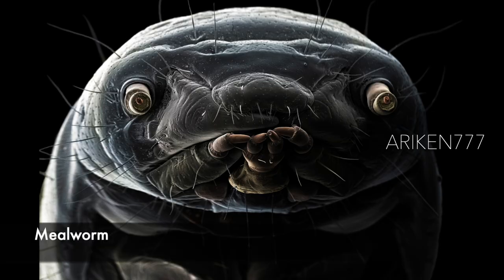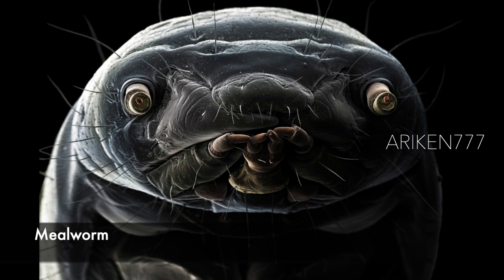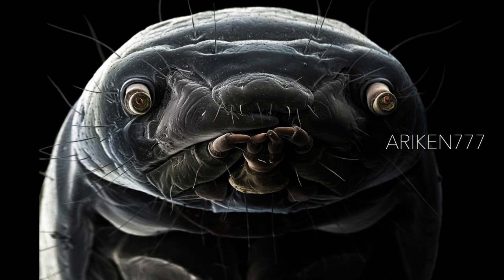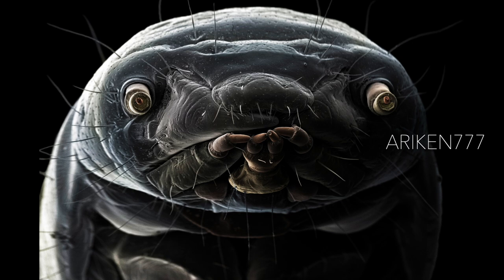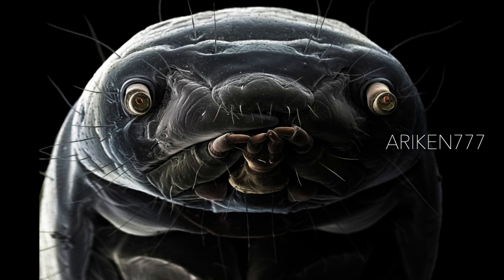This is a mealworm, the larva of the Tenebrio beetle. They are often used as bird feed and fishing bait and are sometimes used for human consumption. Insects contain a far higher protein content than meat from traditional farm animals. It is thought that insect-sourced protein could be the answer to food shortage problems of the future.